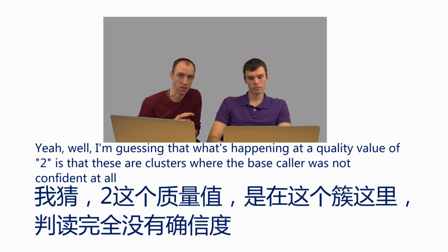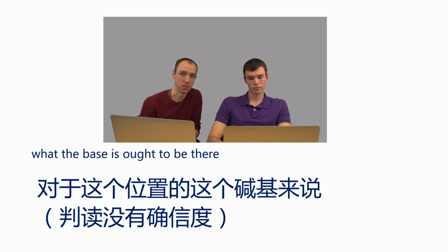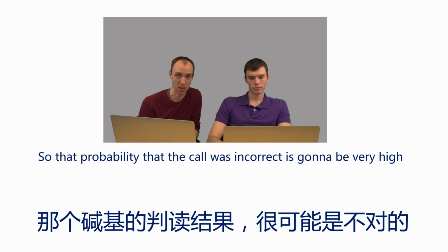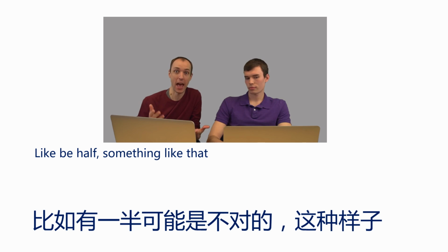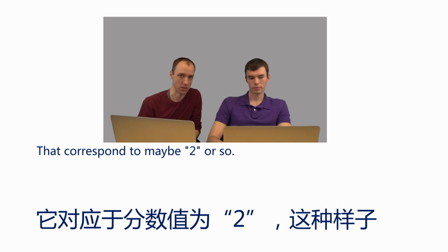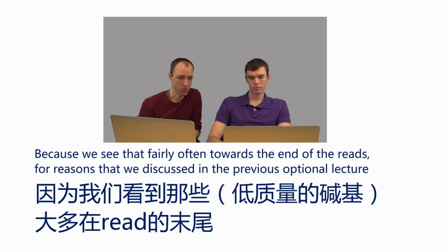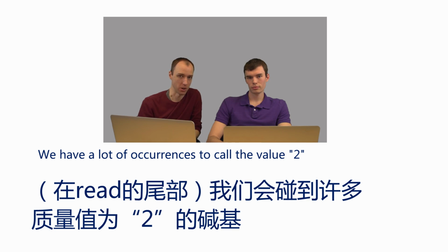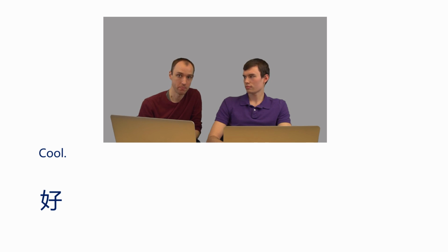Yeah, well, I'm guessing that what's happening at a quality value of 2 is that these are clusters where the base caller was not confident at all about what the base ought to be there. For example, if it was an equal mix of colors coming from that cluster, it will have very low confidence, and so the probability that the call is incorrect is going to be high. It's going to be like a half or something like that. And that corresponds to a very low Q value, maybe 2 or so. Because we see that fairly often toward the ends of the reads, for reasons that we discussed in the previous optional lecture, we have a lot of occurrences of a quality value of 2. Cool.